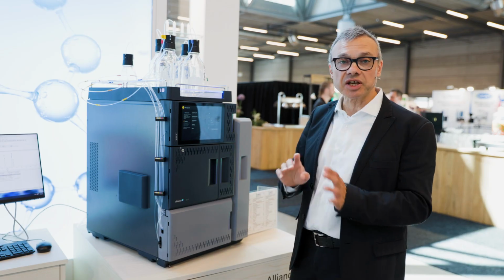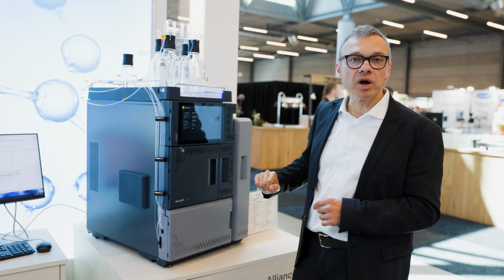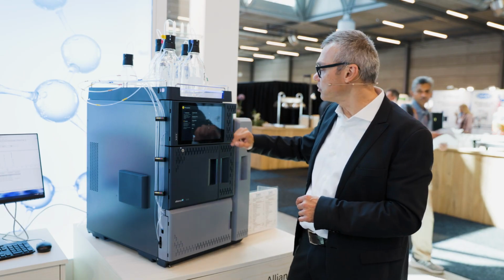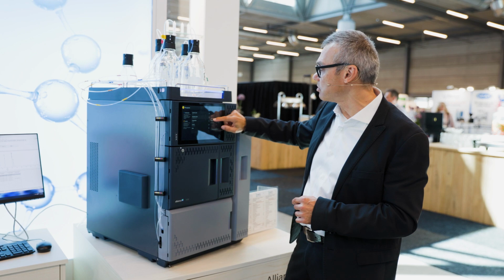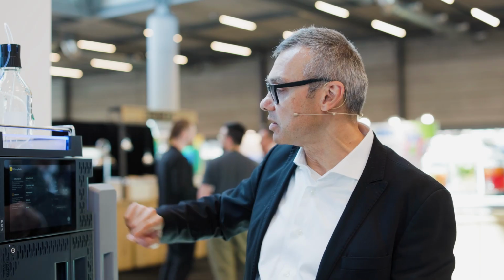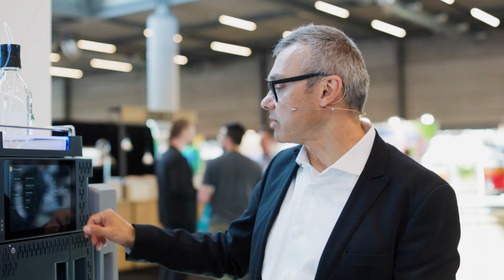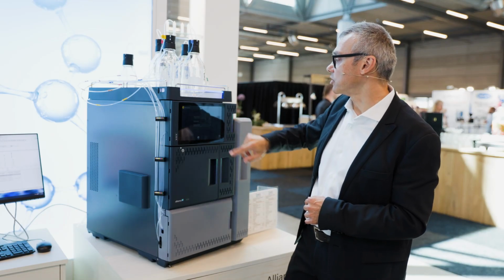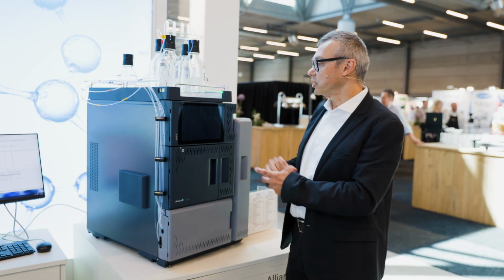Now the mobile phase just prepared will expire in 1 month's time from today. So I have an easy button to do that, and I can confirm if it's not 1 month. I can say okay, it's 2 months, so it's 2 months from today, it's done, and now I can start my whole procedure. And then I can start priming the solvent lines the proper way and so forth. So this is now done.